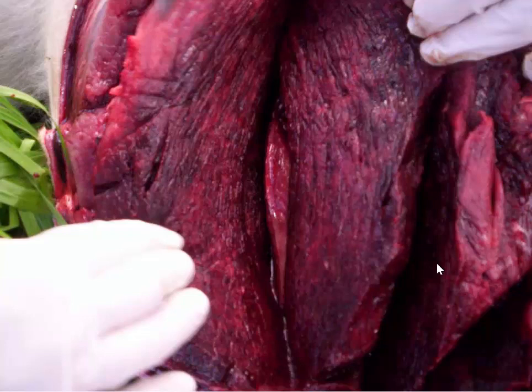In the heart, that's a tough one. People think, well, maybe it's a lot of stress, and catecholamine release will result in an environment that is beneficial for Clostridium chauvoei. But a great picture of Blackleg right here. And we only have one more for this particular Gross Path Challenge.